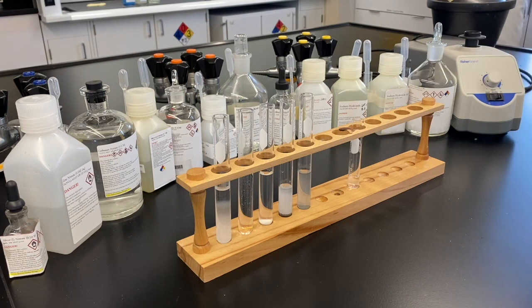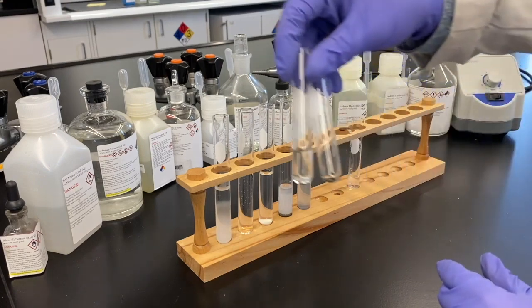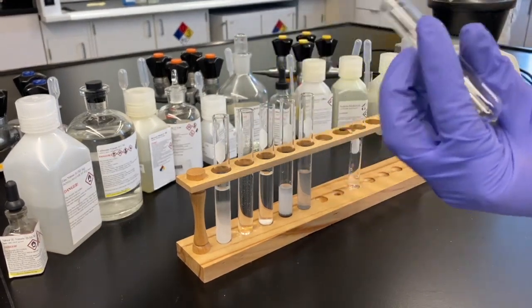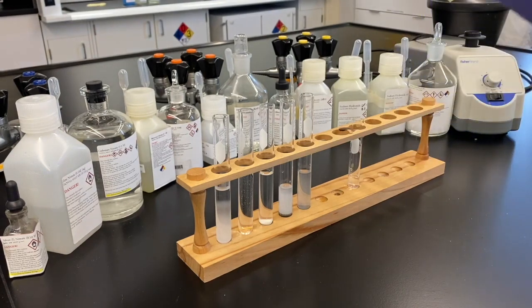We know about that. So this would be a good lab to really practice your organizational skills, right? Labeling all your test tubes, because you could definitely mix these things up and get kind of lost and have to start over. Thankfully, we kept very good track of it for you.